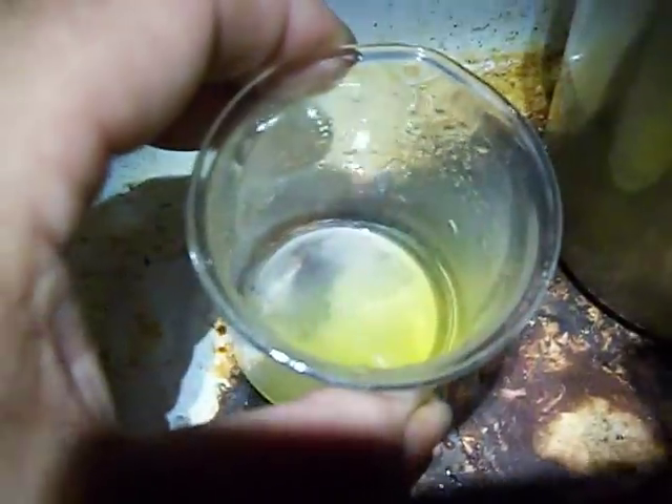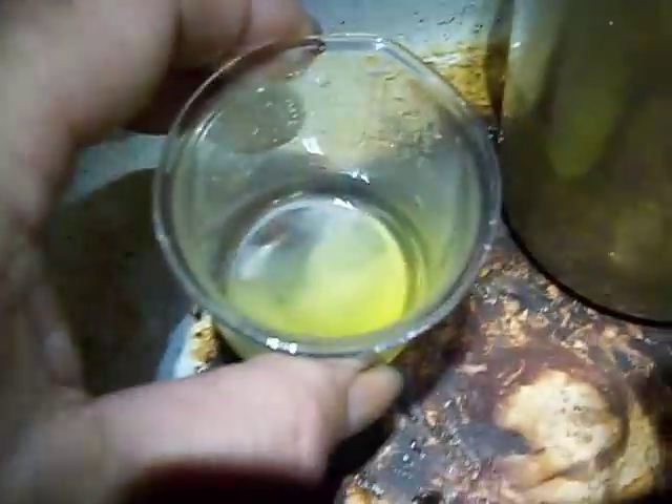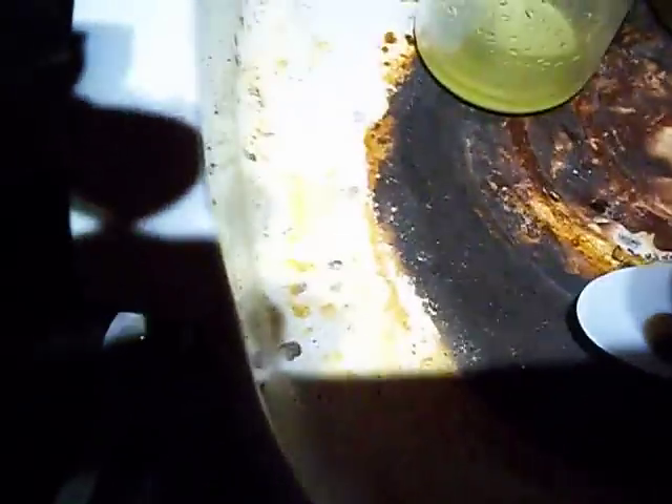Like I said, this was the silver chloride that fell out. And then you've got what's in the filter — all this black stuff that you see in this pan is not necessarily just carbonized crap.